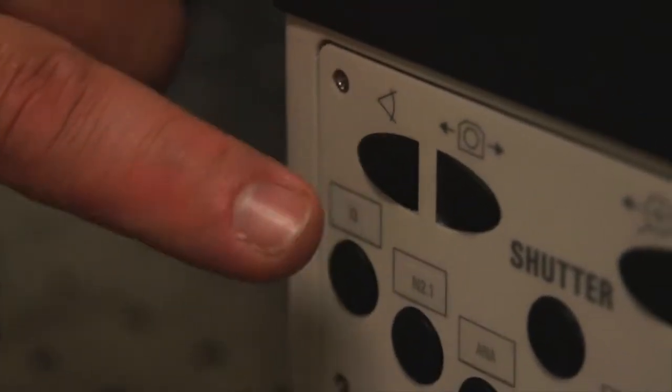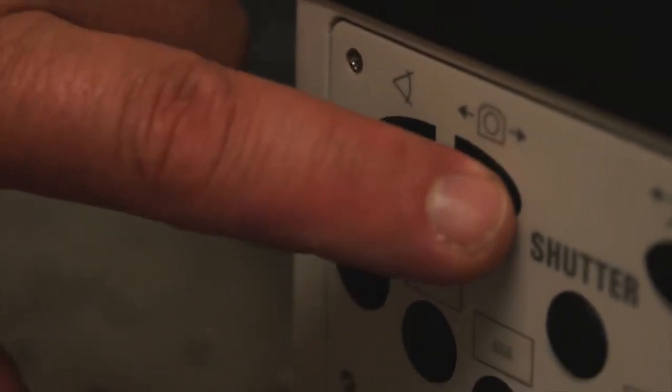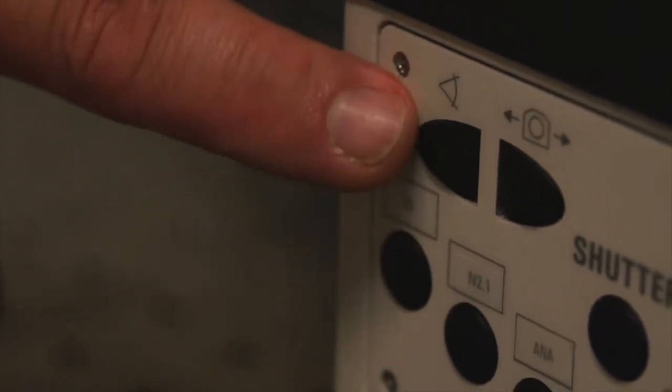We will show you momentarily how to look down the tube of the microscope to know where your aperture diaphragm should be set. On the front panel of the microscope are two buttons that direct the light to observation or to the camera, which is built into the side of the microscope. You shouldn't be manipulating these buttons unless you need to do photography right off the microscope. The second to last line on the screen shows the beam path and whether it's directed to the camera or for observation. By actuating the observation camera button, you can see that 100% is directed to observation or 100% is directed to the camera.